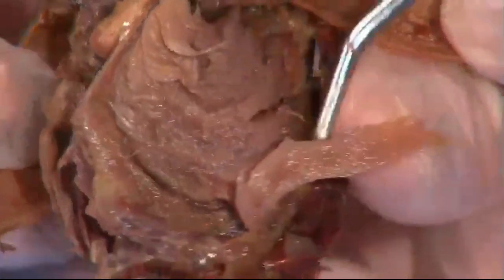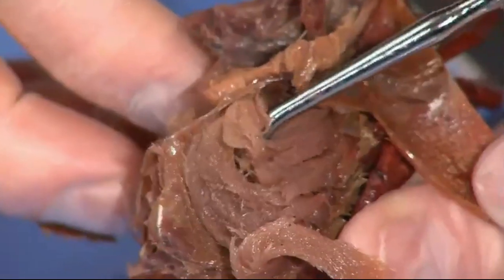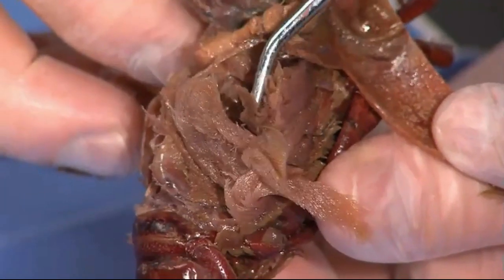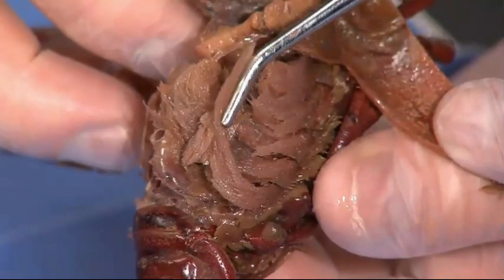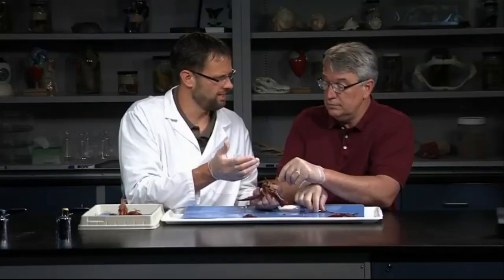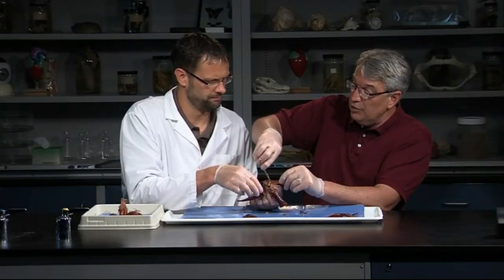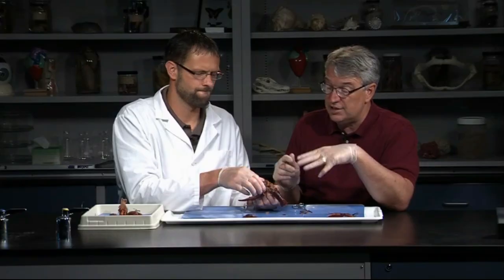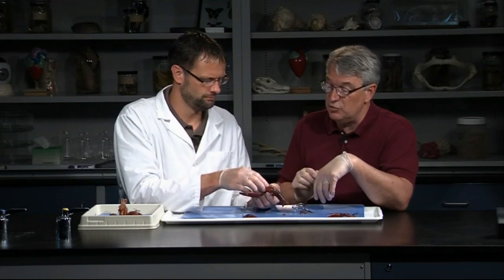We did mention some very prominent structures here on either side of the animal — these feathery gills. You can see there's a lot of surface area there for extracting oxygen from the water. That feathery look is what a lot of gills look like, and they're very large gills on both sides of the animal. Once in a while you see these on land? They can keep water inside of that cavity — like some land crabs, Christmas Island robber crabs in tropical areas. They can keep enough water inside those chambers to breathe on land, but that's relatively rare. Most of these push water over their gills.